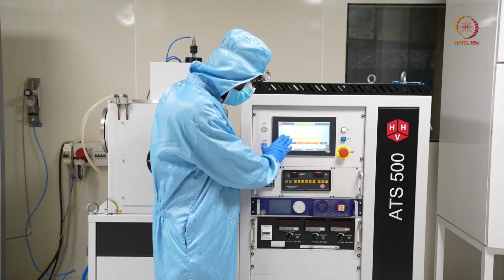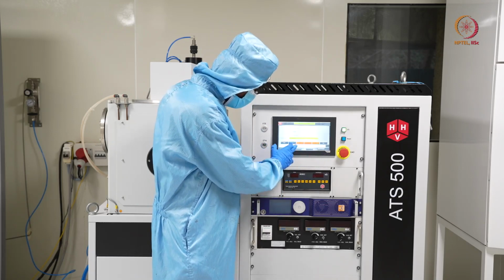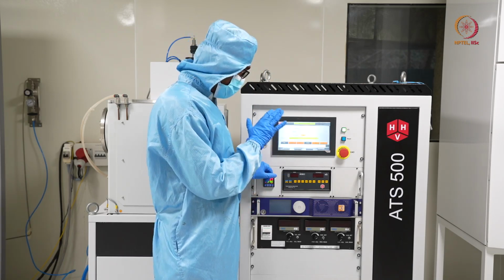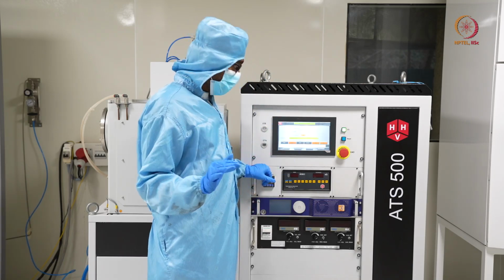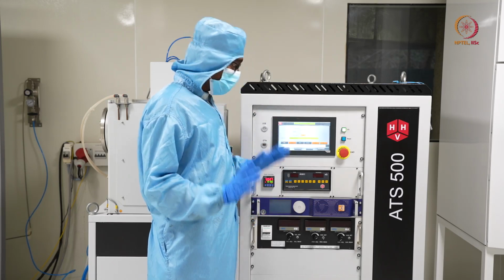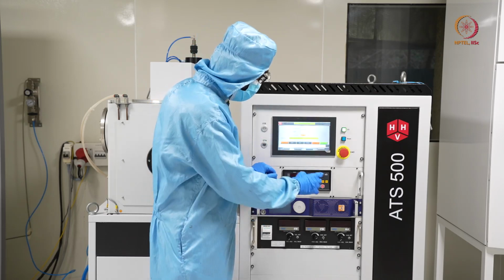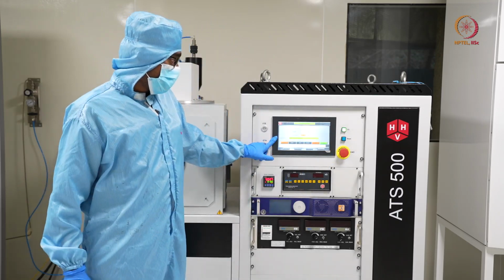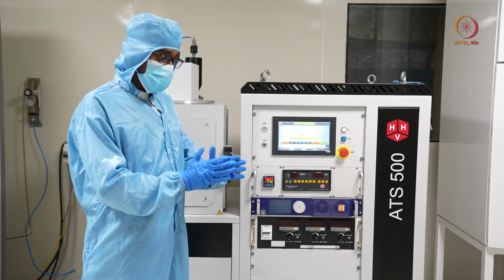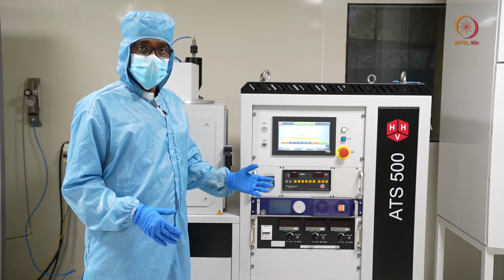Here, you can see it is almost 5 e power minus 5 now. It is good to switch off, so we will seal it first. I pressed seal. You wait as long as the sealing process is done. We can see the system status as chamber seal. So sealing is done. After that we will press stop. Stop means you can see immediately the turbo pump is decelerating. When this is stopped, after that the other pump, that is the rotary pump, will also be stopped.